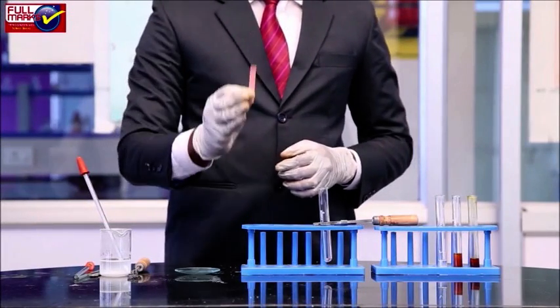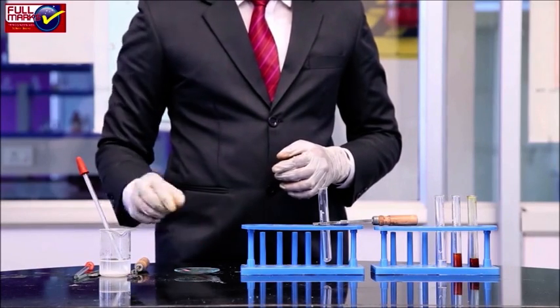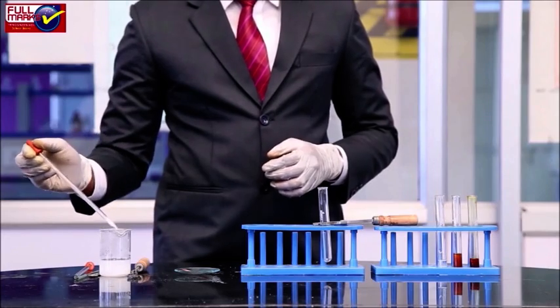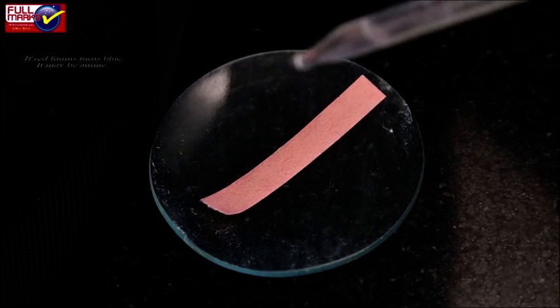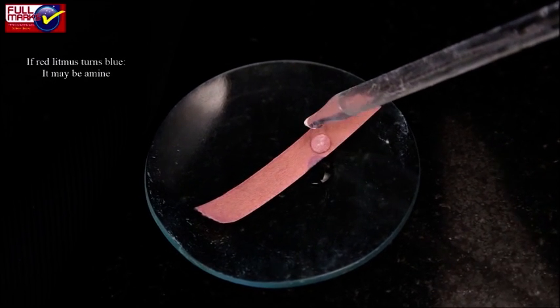Take a red litmus paper and add 1 drop of organic liquid on it. If red litmus turns blue, it may be an amine.